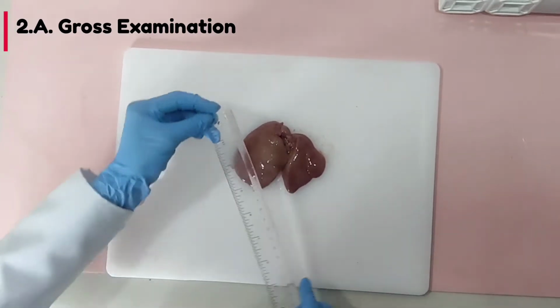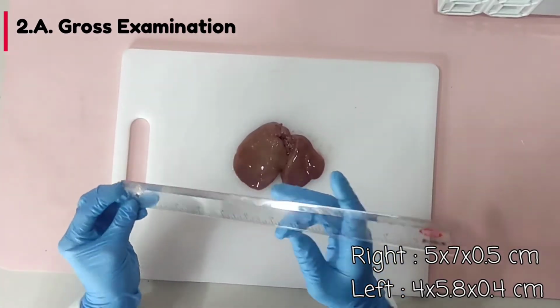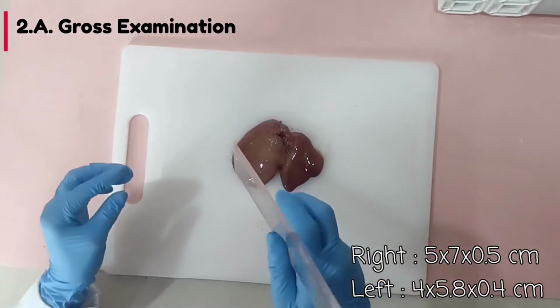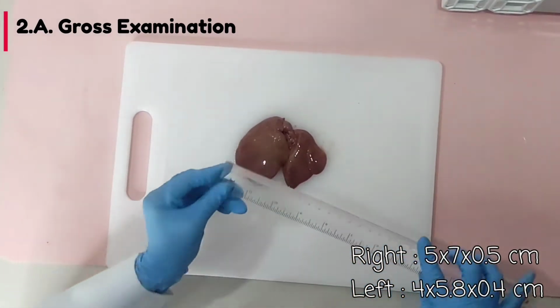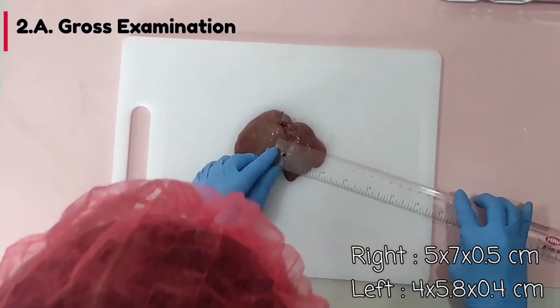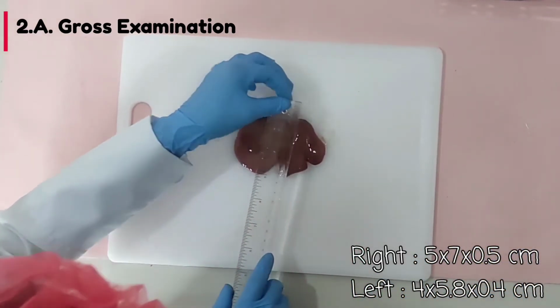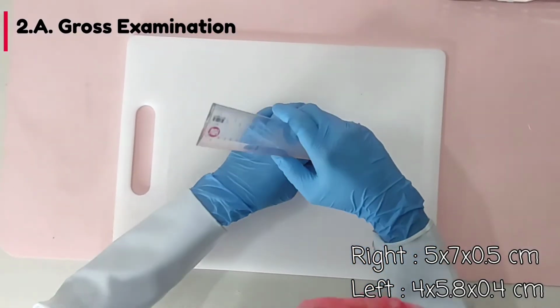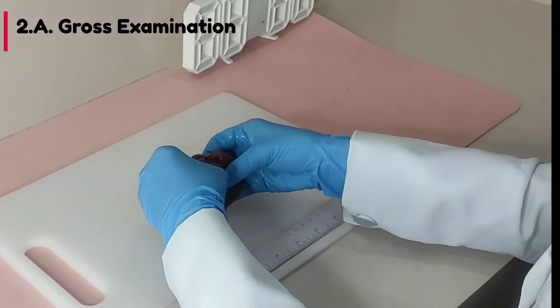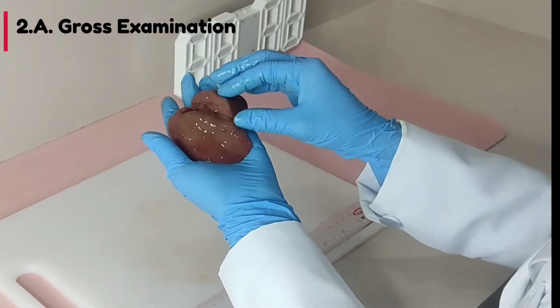So it is 5 by 7 centimeter in greatest diameter and 0.5 centimeter height. Next is the left lobe. The left lobe is 4 centimeter by 5.8 centimeter in greatest diameter. Height is 0.4 centimeter. The capsule is smooth, glistening, and unremarkable.